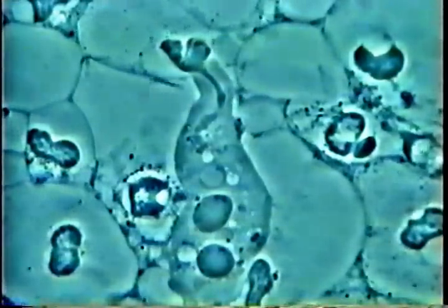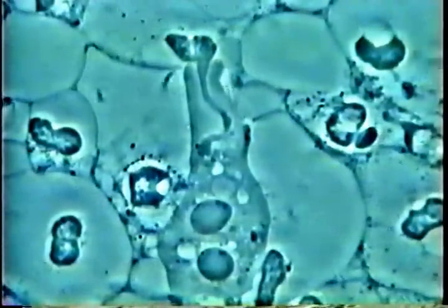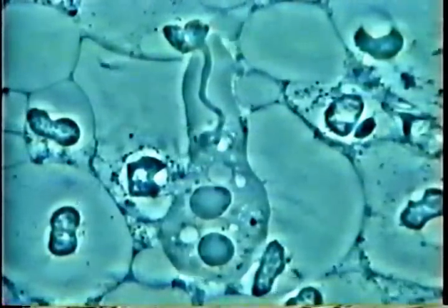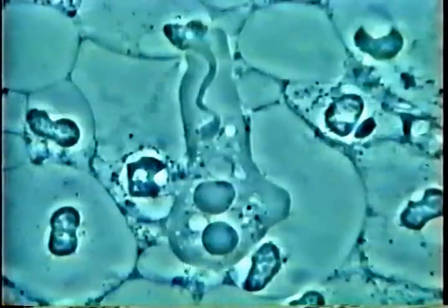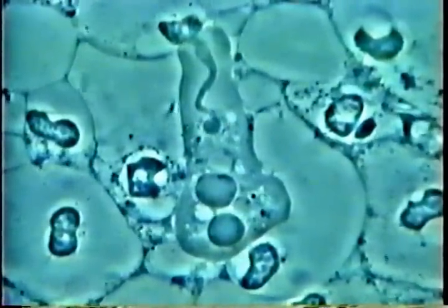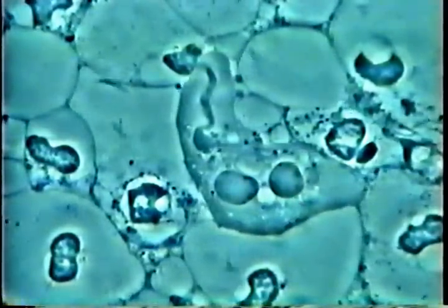You see around the other white cells, some of which have lost their nucleus because the amoeba already fed on them. This happens all the time in chronic or aggressive periodontal disease — you always see those amoeba feeding on white cells. It has now phagocytized almost one third of the nucleus. In the middle of the amoeba you see a round little nucleus called the karyosome, and at the bottom you see two more dense rounded portions which are nuclei the amoeba has already fed on before.